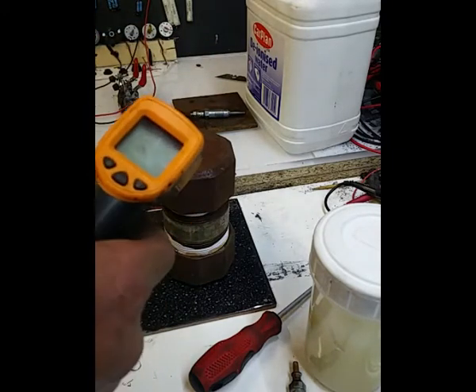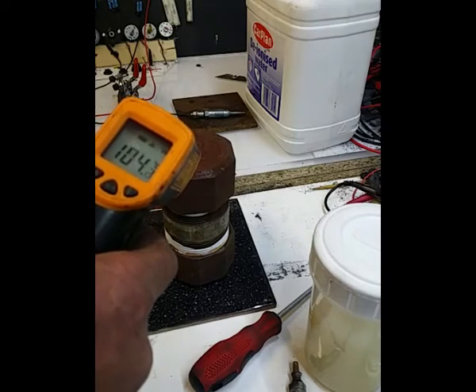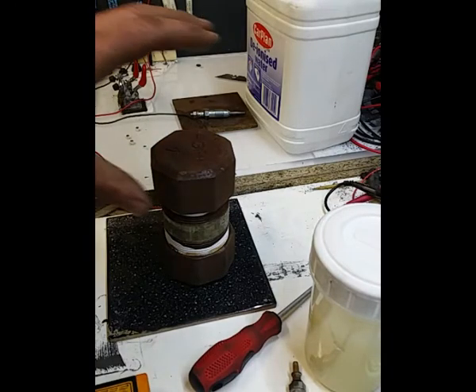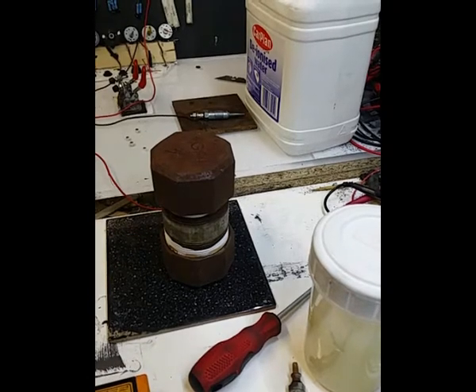So yeah, we've got the 104 degrees on the top. So it's kind of working. I'm quite pleased because it is working. So I've got a leak as well. Haven't tightened it up enough. Very, very slight leak there. Just see that bubbling away.